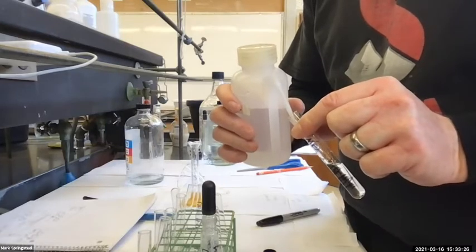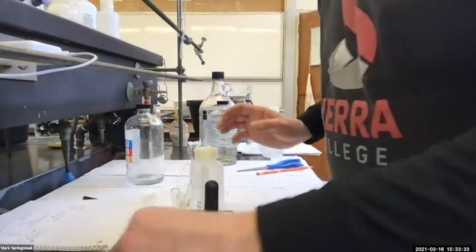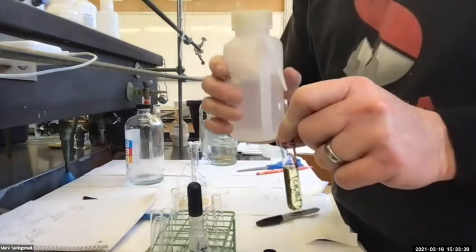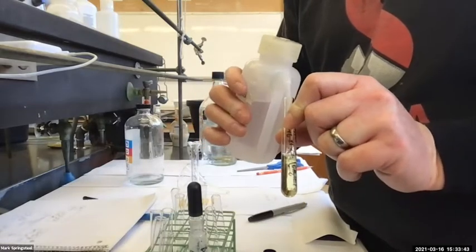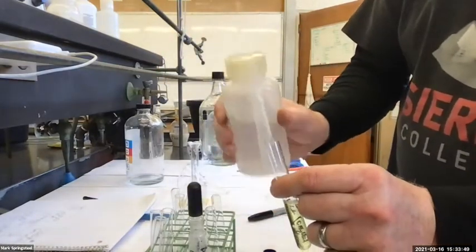Dissolve. Yeah. I added a squirt, it dissolved. Looks good. If I put the water in this organic layer, it'll form 2 layers, huh? I can actually do it because it won't matter for the next part of the experiment. I'll show you. So let me put a squirt. I didn't put quite enough. Let me do a little more.